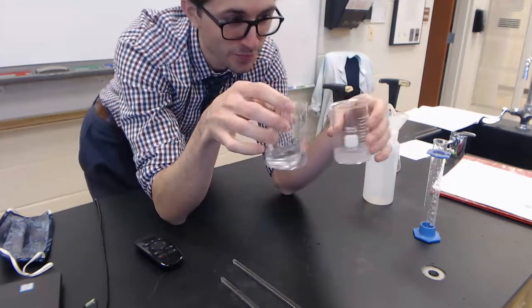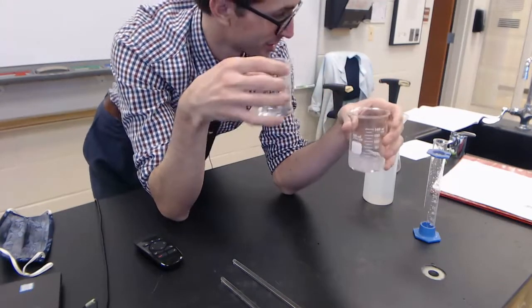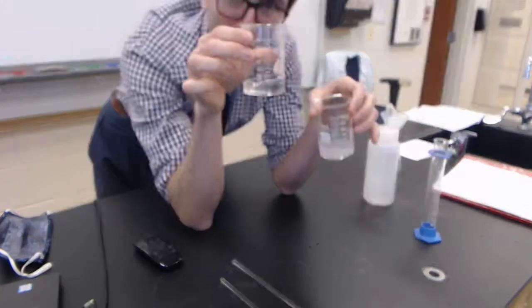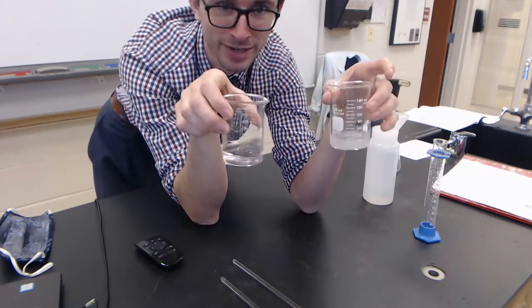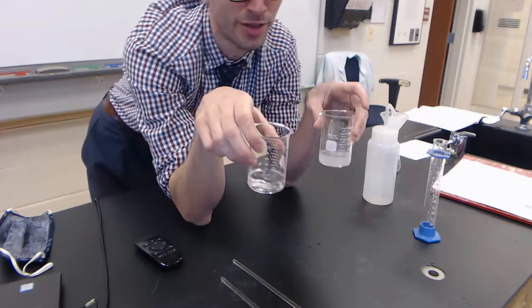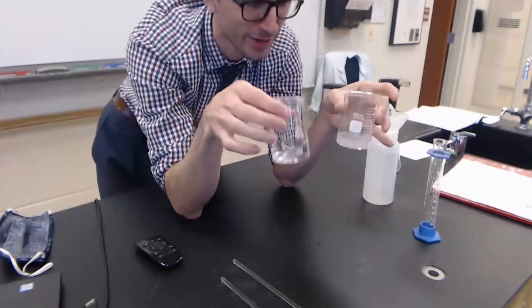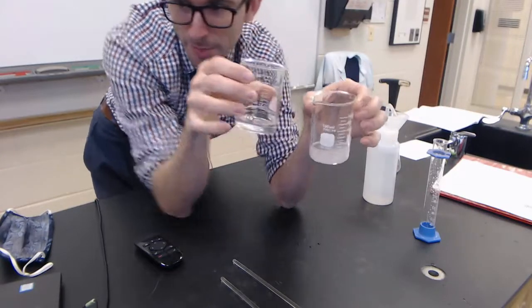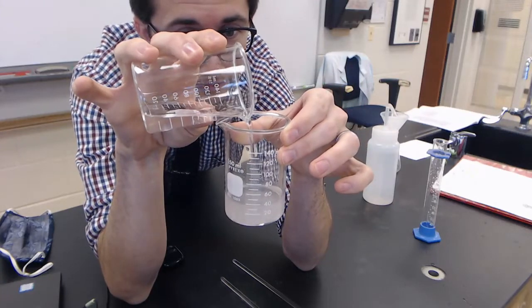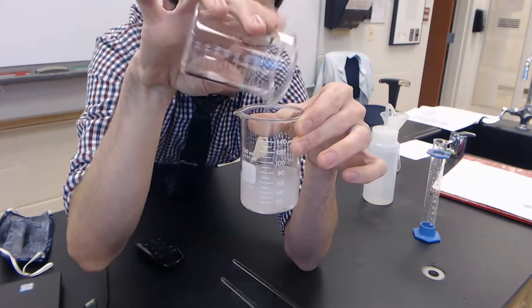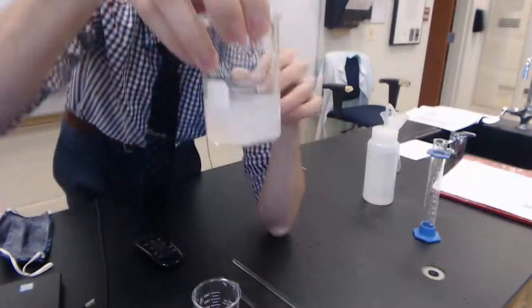I've got my two solutions. Next part of the lab is to actually mix the two. You're going to see me do something similar with the distilled water because I want to get everything from this beaker into here, just like if you pour out chili from one bowl into another. Let's mix these two together. Let's see what we get. Let that sit for a little while.